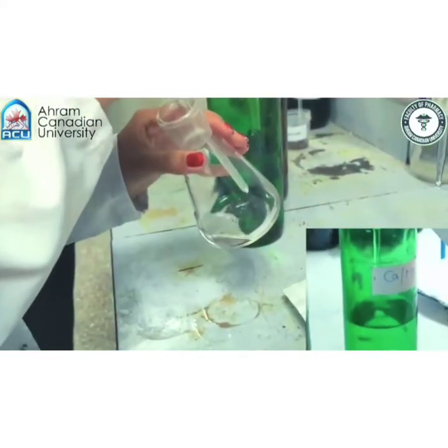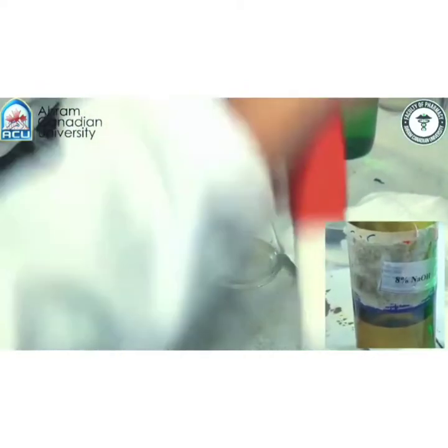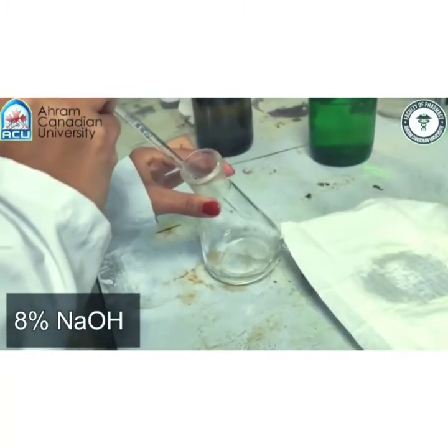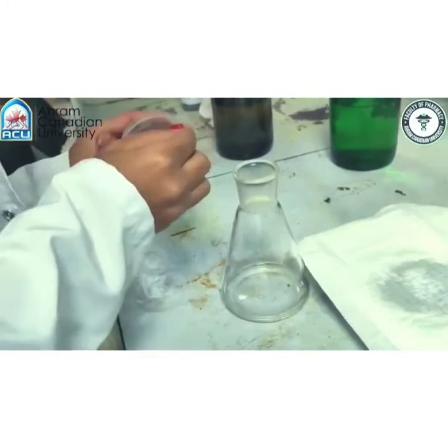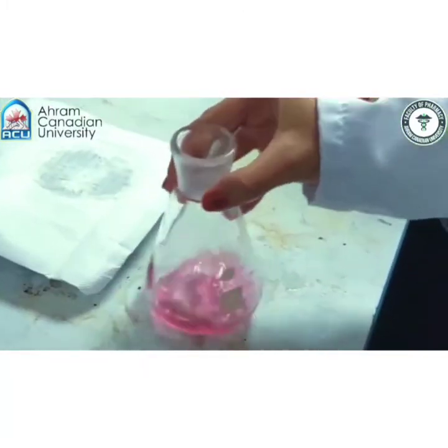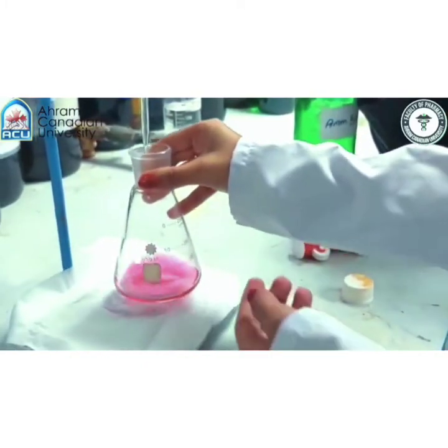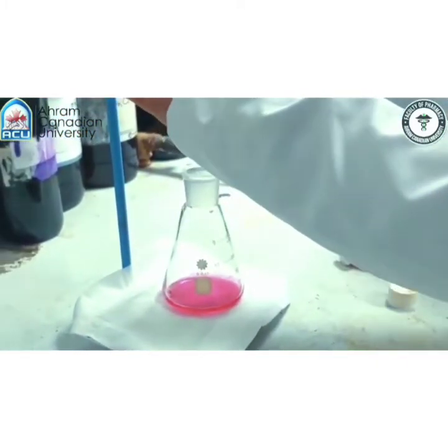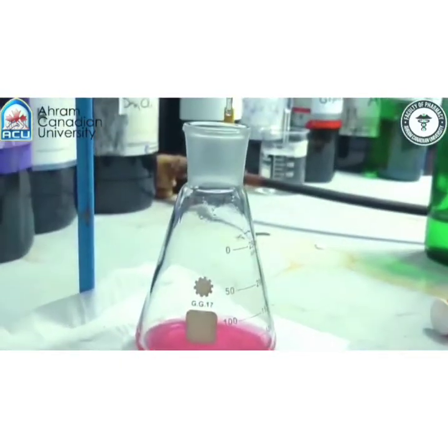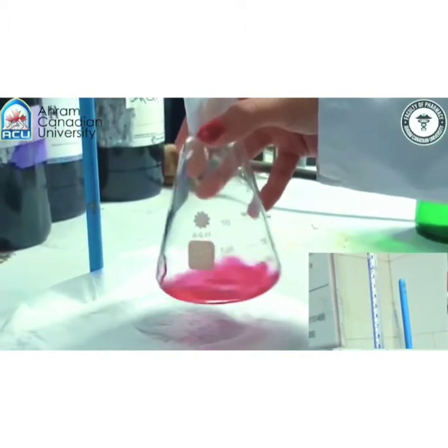In another flask, we add 10 ml of calcium magnesium mixture again, and then 2 ml of 8% NaOH to precipitate the magnesium away in the form of magnesium hydroxide. Now a few specks of murexide to give us a pink color, which is before titration. And again, we titrate dropwise, since the color change reaction is slow in this complexometric titration, until we reach our endpoint, which is purple color.